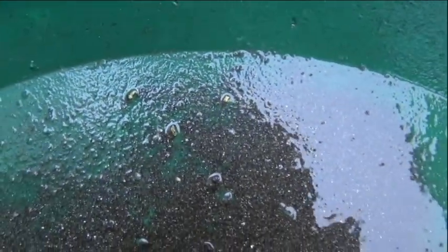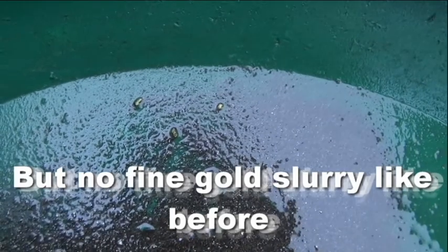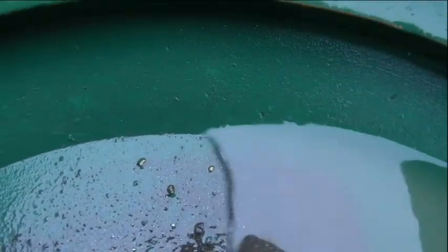Right. More gold. 3 bits there. There's another pan. There's still gold in it. Not a lot, not as much as what it would have been if I'd have just panned it the second time around. So it has dissolved some, but these probably were fairly big pieces to begin with, those ones, but there is still gold unleached in it, or dissolved, undissolved. I suppose it takes a while to dissolve large pieces. Who knows how big those pieces were in the beginning.